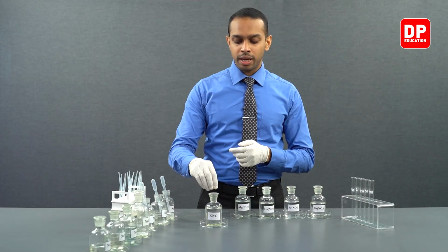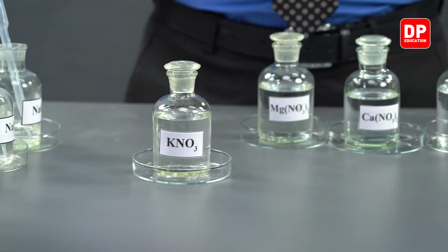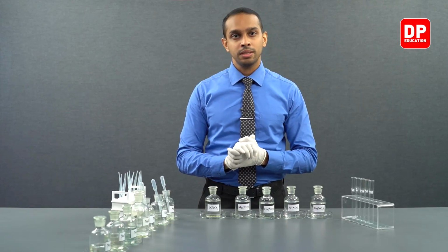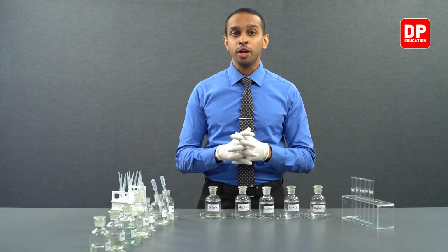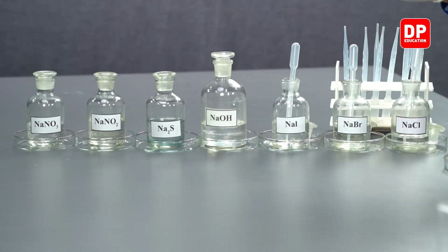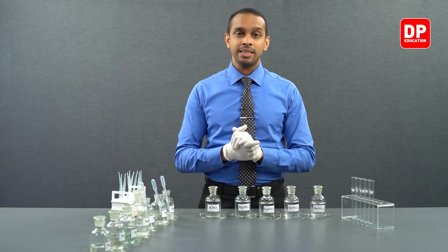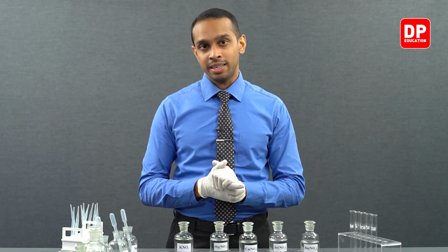So whatever that we add onto potassium ions in this experiment, you would notice that they do not produce a precipitate. However, you will notice when it comes to group 2 cations, most of the group 2 cations will not produce a precipitate with uni-negative anions. Uni-negative anions such as chlorides, bromides, iodides, or the halides, hydroxides, bicarbonates, they will not produce precipitates. But some cations will produce precipitates with certain anions.